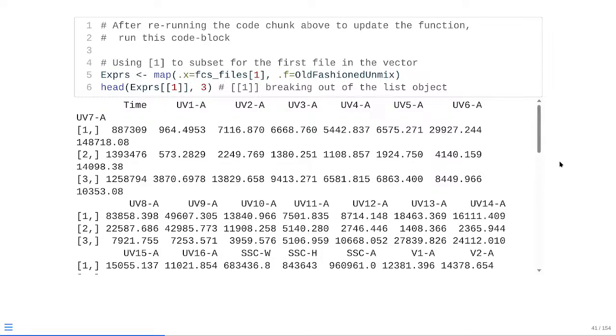At that point, refresh the function, rerun our output line, and we get back a little matrix style object. Obviously, there's 10,000 different rows at this time, so I'm just going to go ahead and use the head function, designating down to 3. And remember, the map function returns a list, which is why I'm doing these little square brackets 1, basically grabbing that first value in that list, which is our particular matrix.